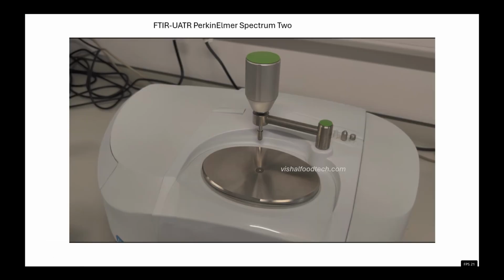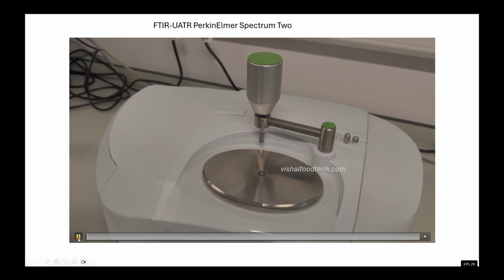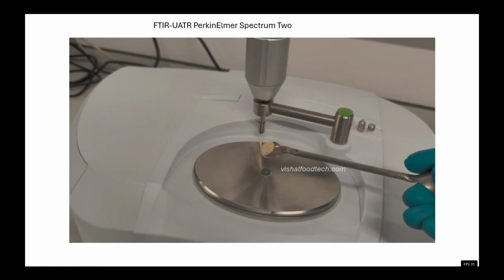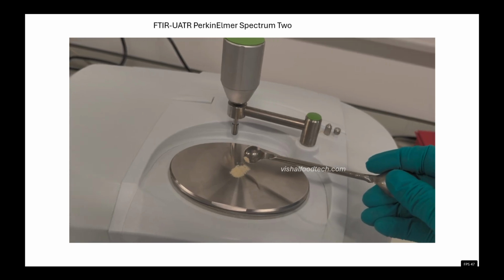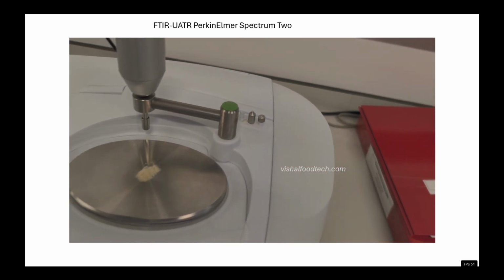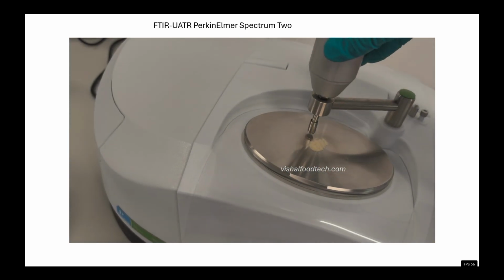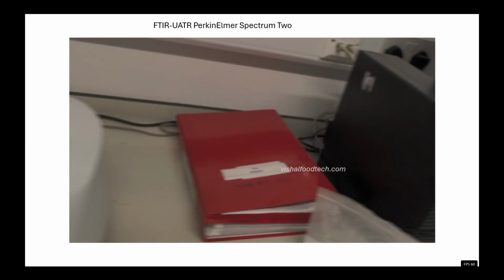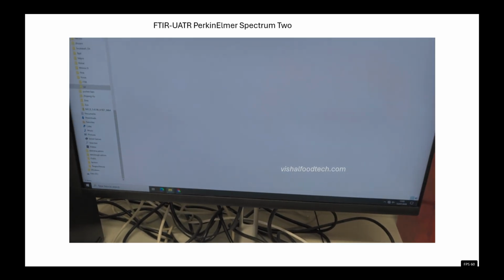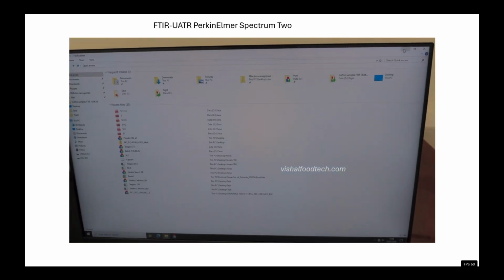Now let's see how to use the sample. So first we will put the sample here. Very little sample, just to cover the surface, and then we will start rotating it, but we will not rotate it fully.